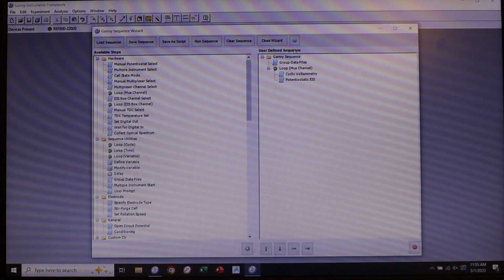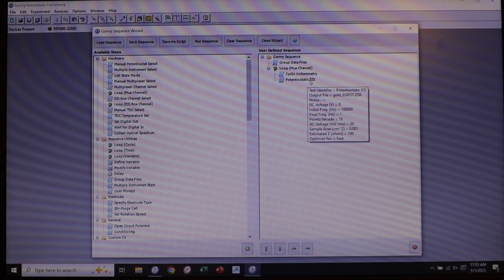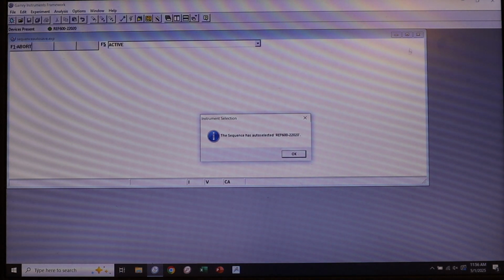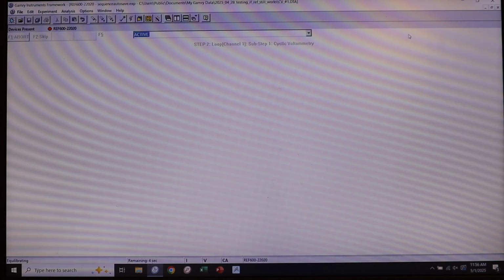So I have a script in our experiment sequence wizard that will run both of these through the multiplexer on all 6 of our gold channels. So we have cyclic voltammetry here, and we have the potentiostatic EIS here. So we're going to go ahead and hit run sequence on that, and all of a sudden you will see our experiment pop up. It's asking that I want to make sure that I'm using this potentiostat, and yes, I do. I have run this before, so I'm just going to replace all of these files with these new ones that I'm collecting, and I'll maximize our screen.